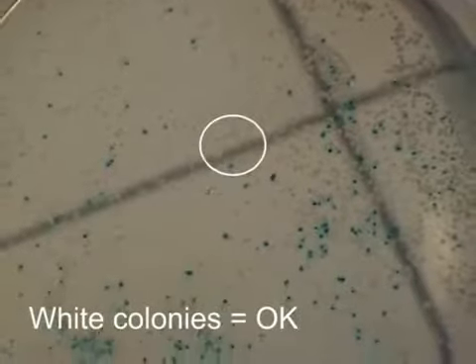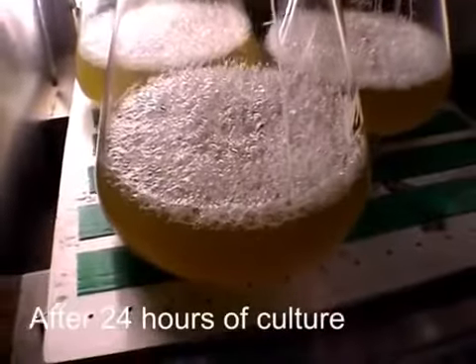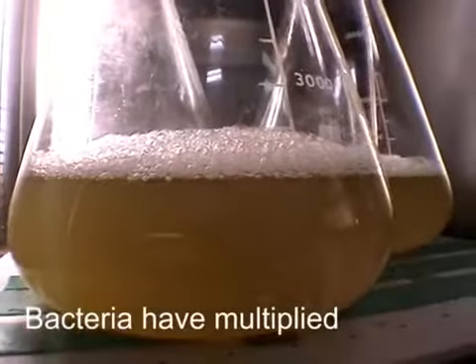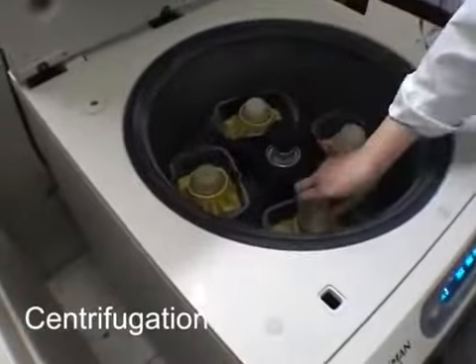A bacterial colony containing the correct gene is then grown as a culture. After 1 night of incubation at 37 degrees centigrade with constant shaking, the cloudy appearance of the culture confirms that the cells are multiplied. The cells are separated from their food and waste products by centrifugation.